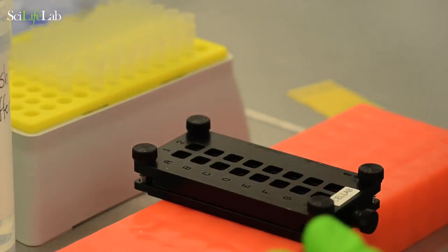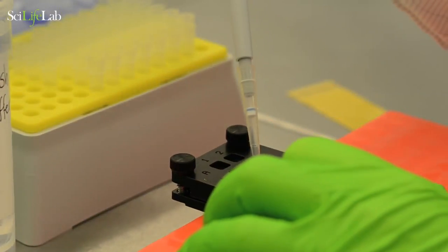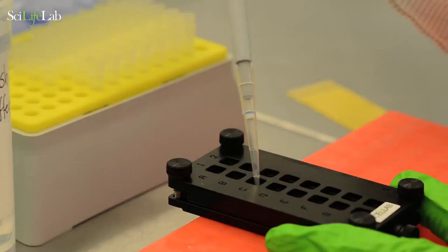Start day 2 by carefully removing the seal. Pipette off the cDNA synthesis mix and wash the wells as before.